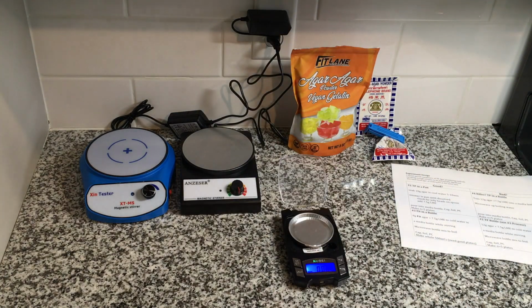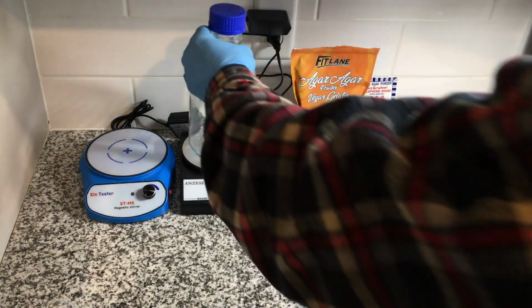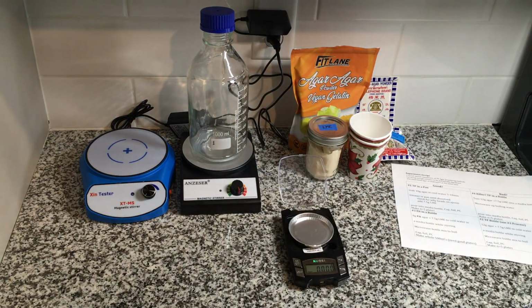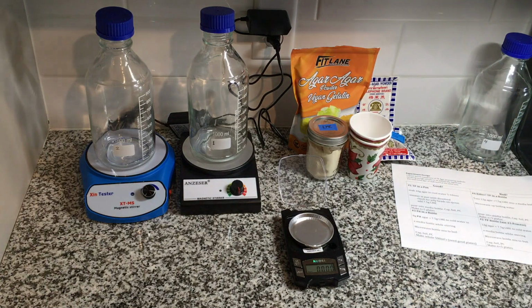But after a careful review of all my notes, photos, and dish labels, I could find a solution that led to a better guess. And then it took a couple of days to get new materials through Amazon and make new agar, and then testing it out. And I found success, so my agar was good again.